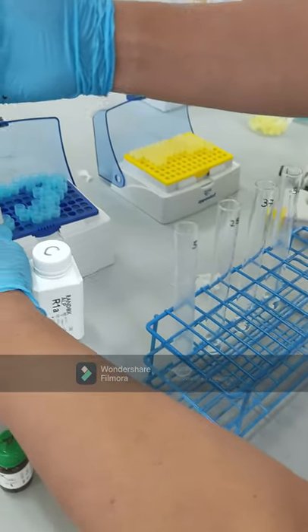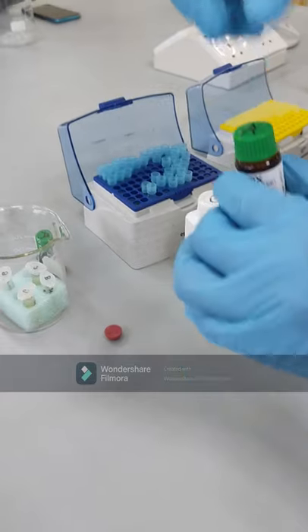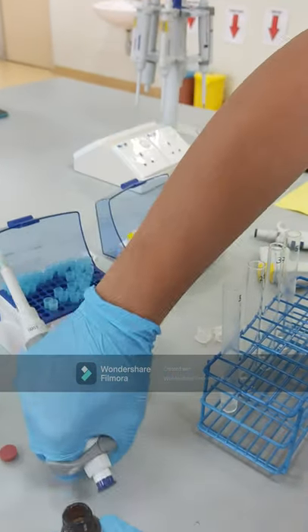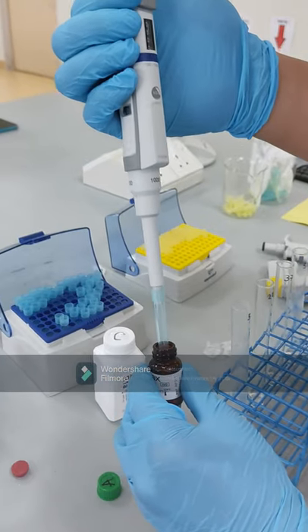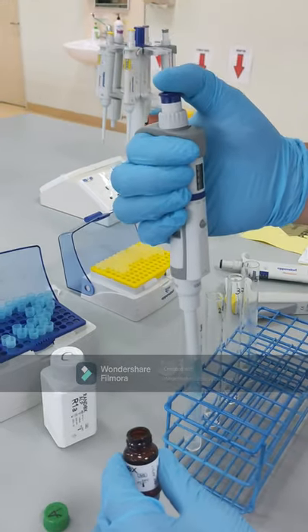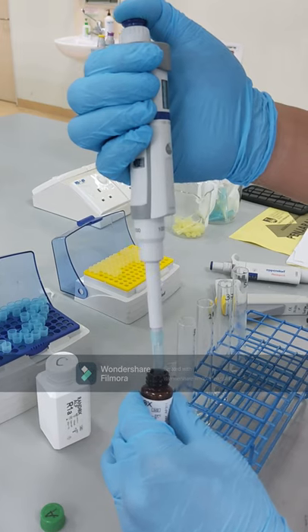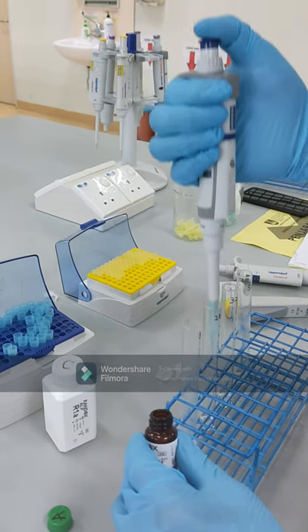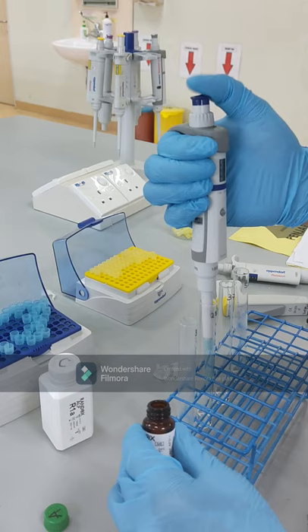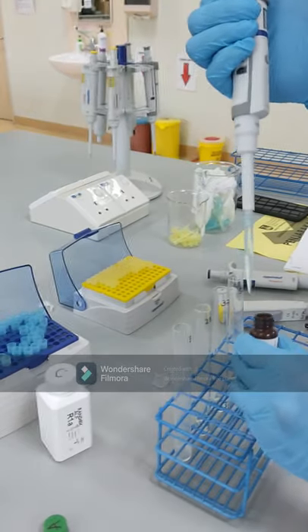After 15 minutes, we will take back each test tube and then add the substrate — tube A, the green tube — with the same volume for each tube, to start the reaction. After finishing adding the substrate, we will mix again and then incubate for 5 minutes.